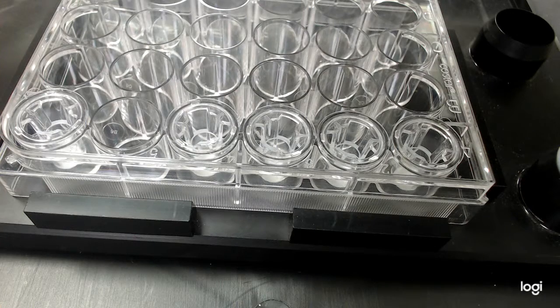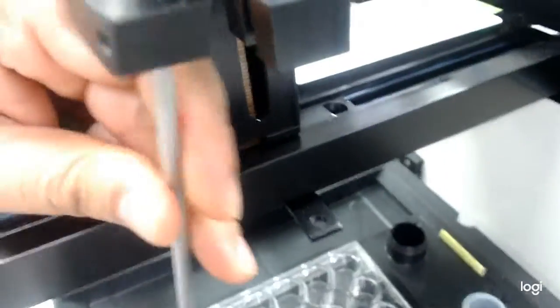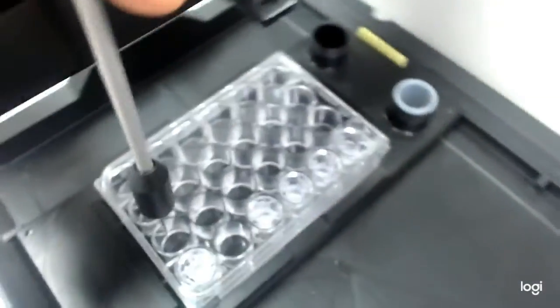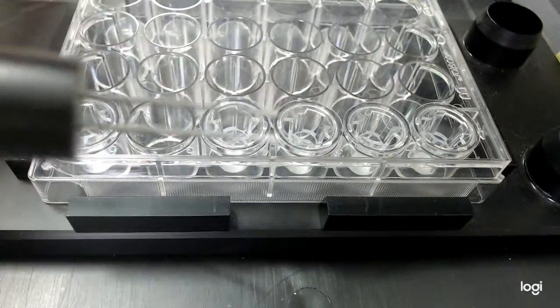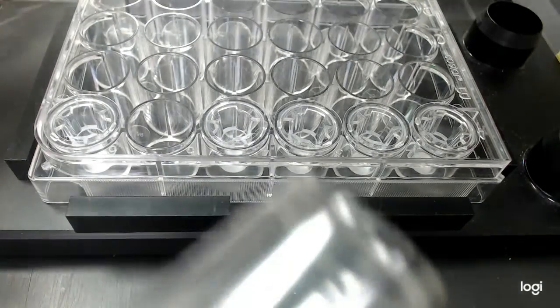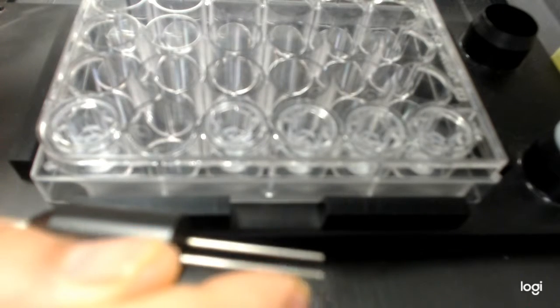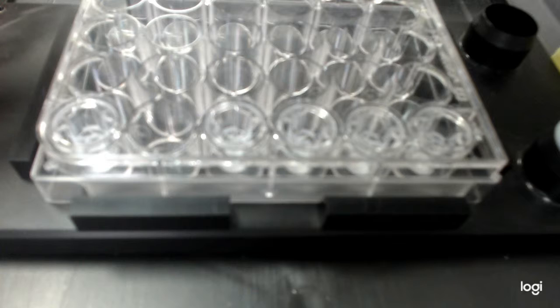So you see what happened? The electrode came off from the base. Let me see if I can focus on this system. The electrode actually came up from this base right now. This is a dummy electrode, but if you have an actual electrode, which would look something like this, you may end up damaging the tip of the electrode. So this is the concern that we have using this system.